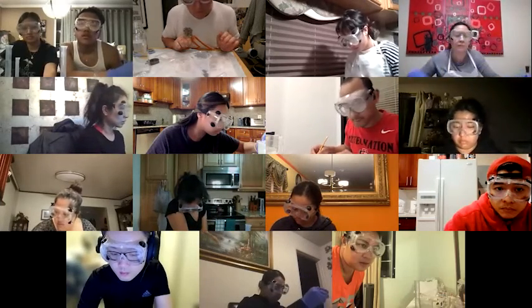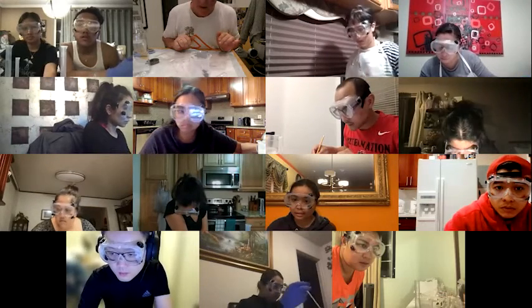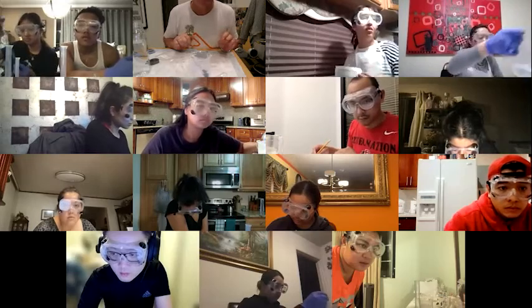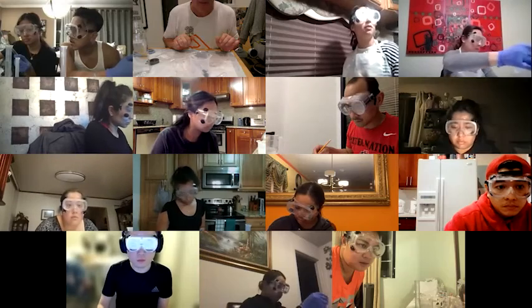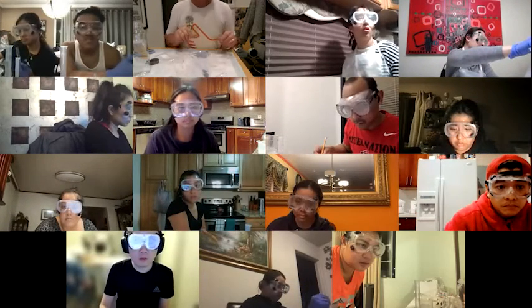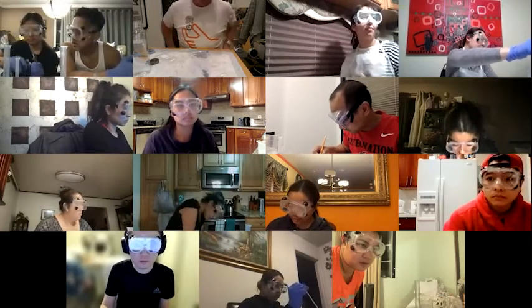No. Trying it with the dilute HCl, I got a bubble. Yeah, I think with the dilute HCl, it will work, but it's really slow. So you may have to leave it, let it sit for a good long time. Oh, there it goes. Yeah, it will work. If all you have is the dilute HCl, it will work. It's just slow as hell.